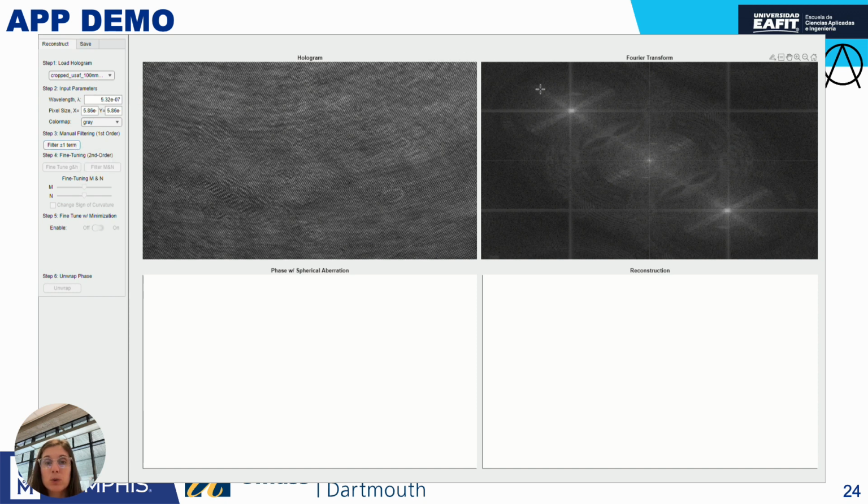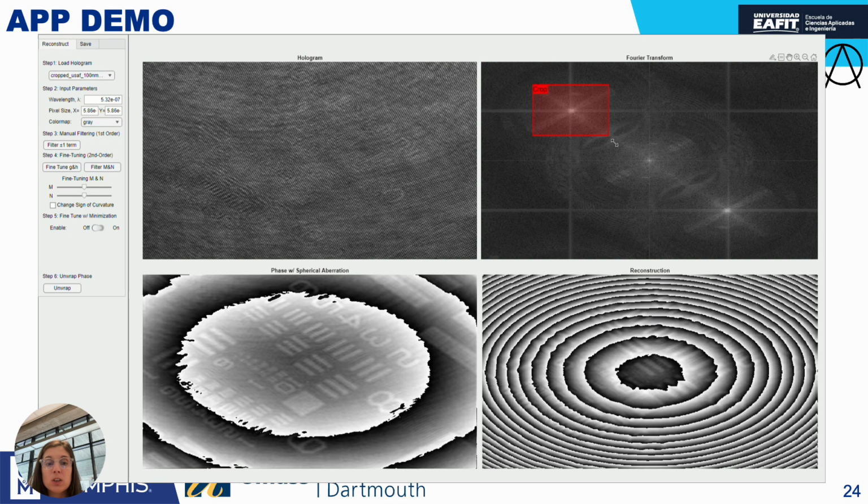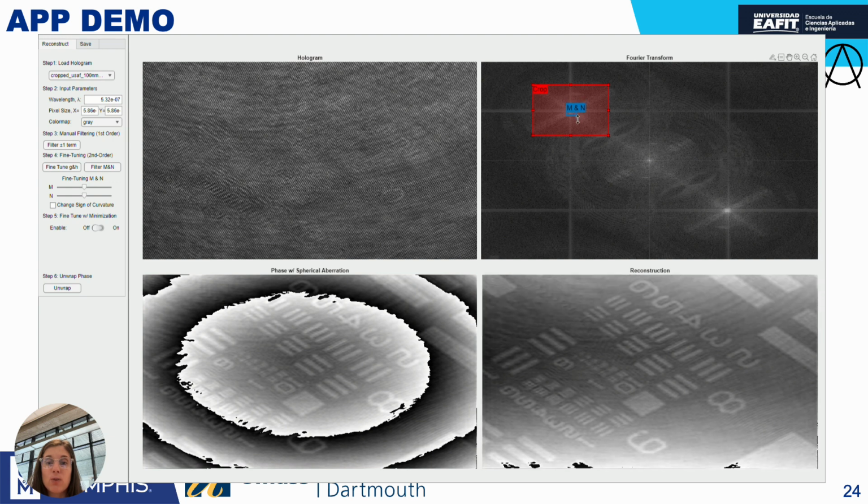So this is a demo of the open tool that we have proposed. Here you have the holograms. You can manually reconstruct the plus one term and try to be pretty centered. You can play around, and the idea is to try to get the spherical waveform as centered as possible, and then you see what it looks like after compensating, and then you center the filter and create a value of M and N. You can do just creating the filter, but you also have a fine tuning of the value of M and N to see that the background is really uniform. So this is us playing with the value of M, checking which is the most uniform.